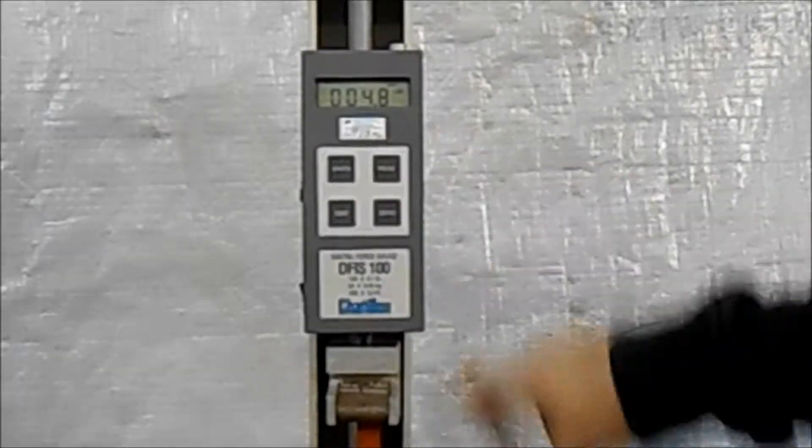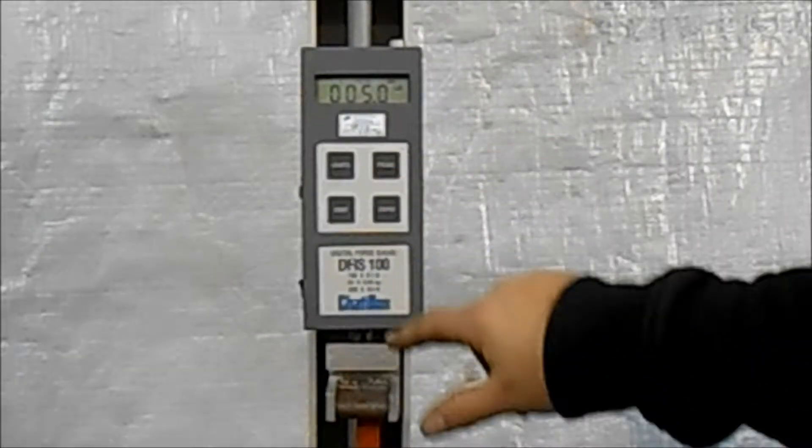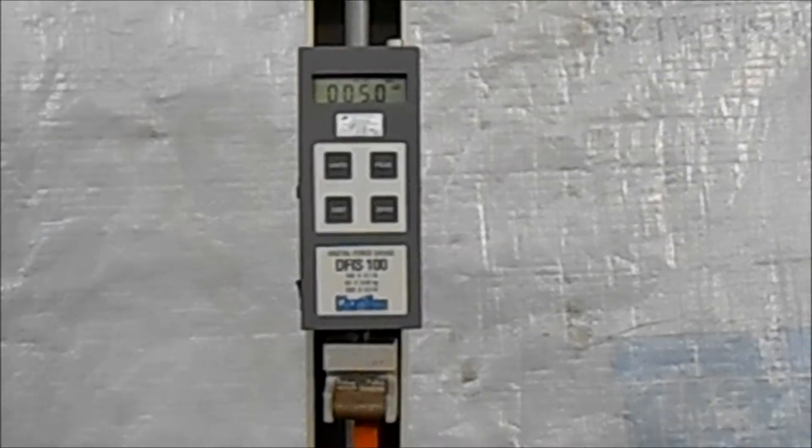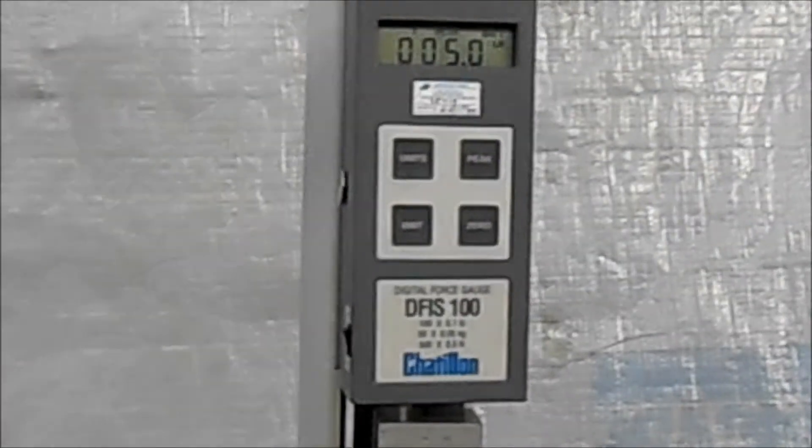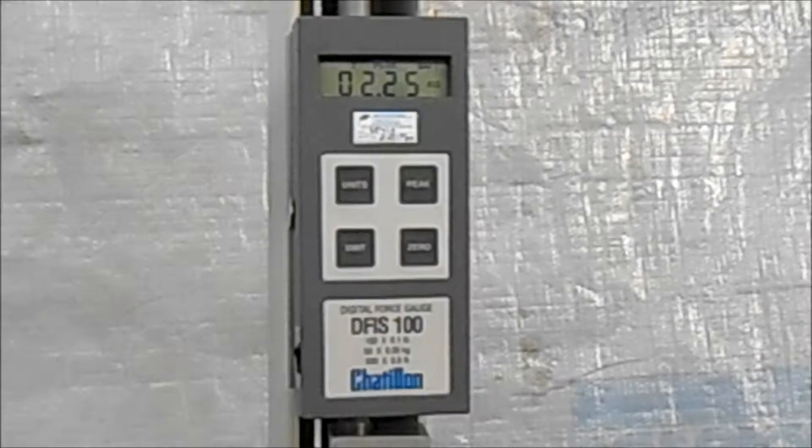We can shut this off and then display peak. In this case it's five pounds of force. Peak force, we can change our units to kgs.